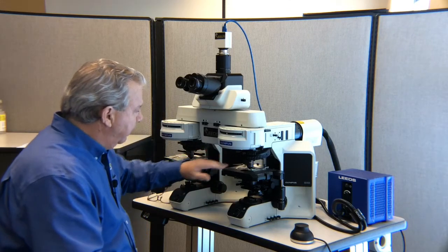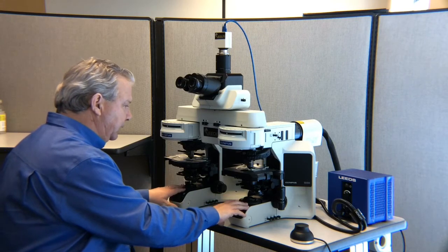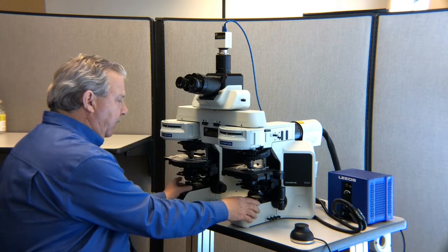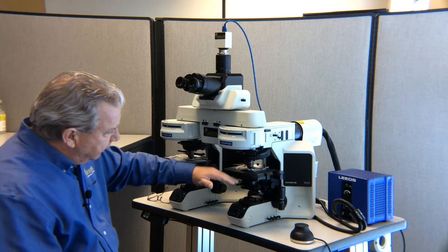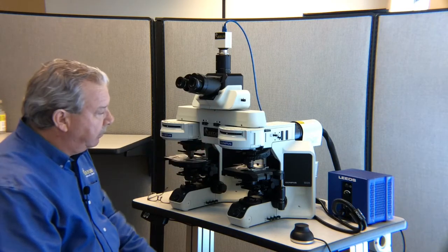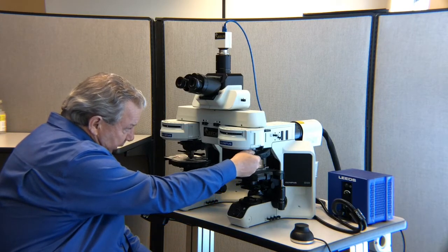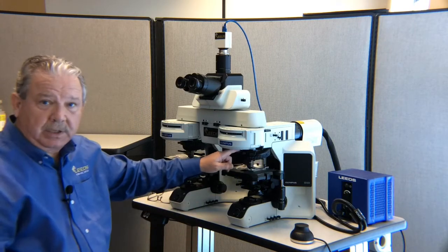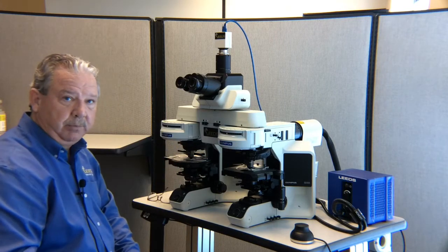Moving up from there then, now I've got my samples in focus, my condensers in focus, I've got my field diaphragm image that I can see, and I'm going to want to continue to move myself up through what is now the viewing ray path and make sure that any filters or compensators that are in the ray path of the microscope have been pulled out.